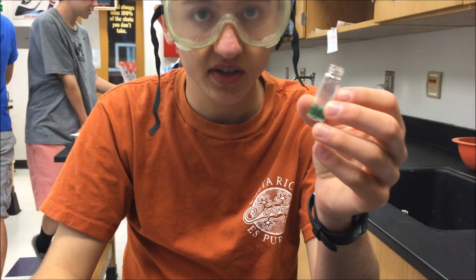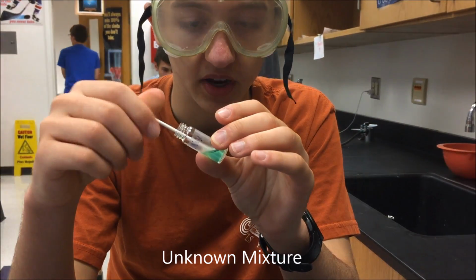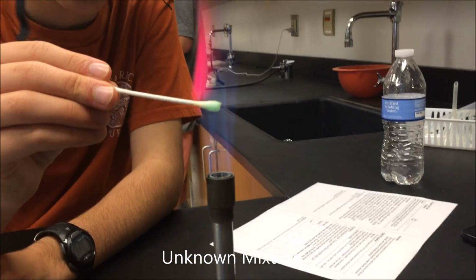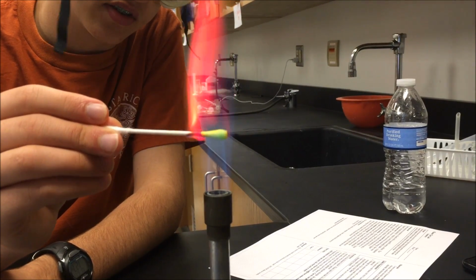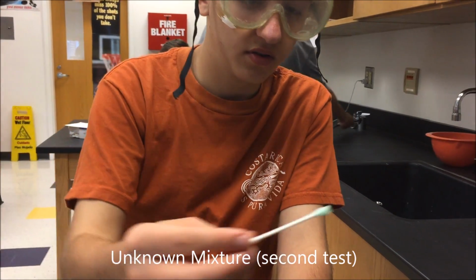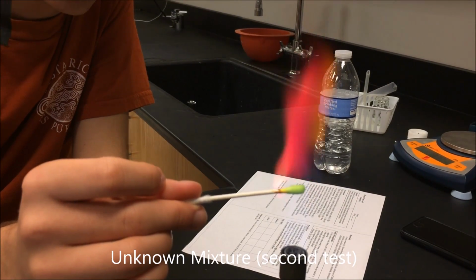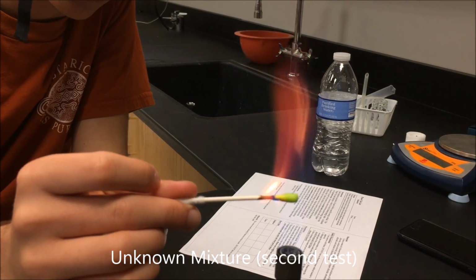The last solution is a mix of two of the prior solutions. So again, using the same procedures, wet the Q-tip, and we're going to place it over the flame and observe the color to see what mix of metals the solution contains. So we can see a nice red color. Again, to confirm our results, we see red and hints of green.